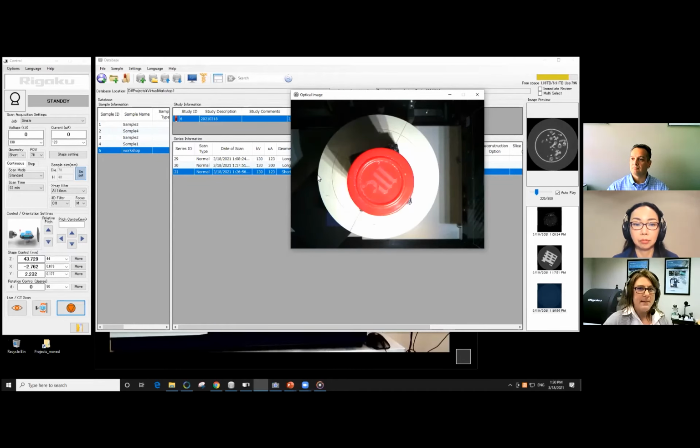All right, so our image is finished. We can zoom in. It's pretty nice. We can see some different phases here. So there's some lighter area inside. The air is dark. We also notice that the material inside has absorption very similar to our container. And that's because you're 3 for 3 and you've chosen the right condition, the right sample container.